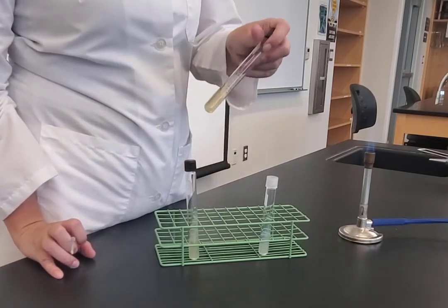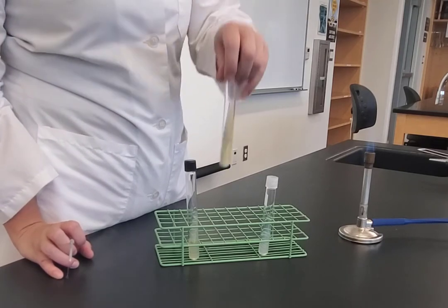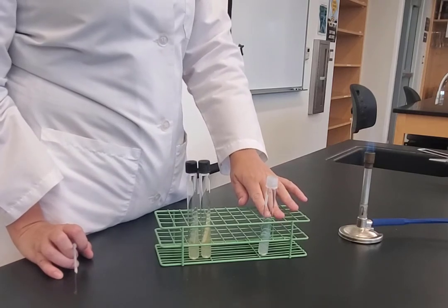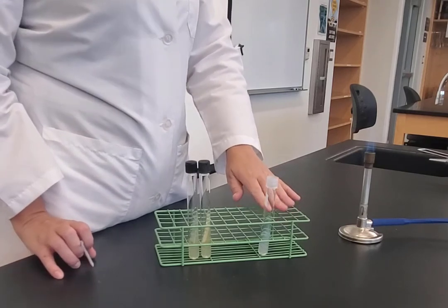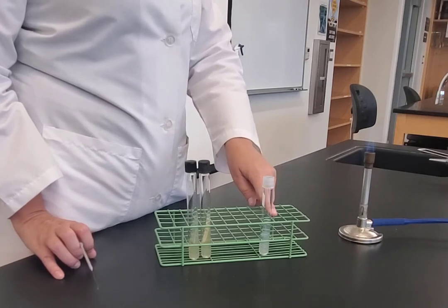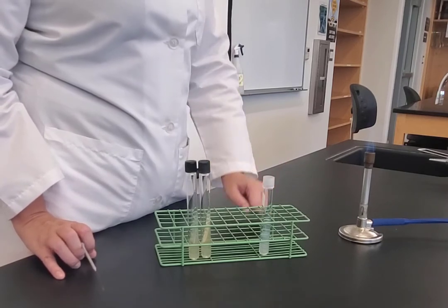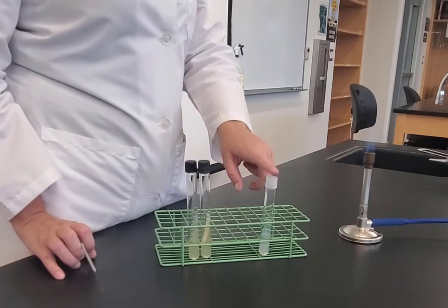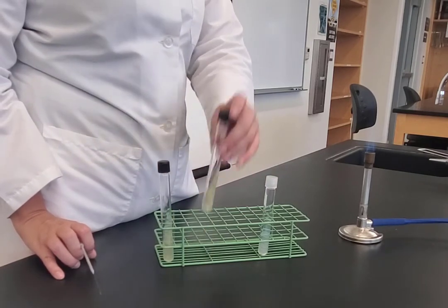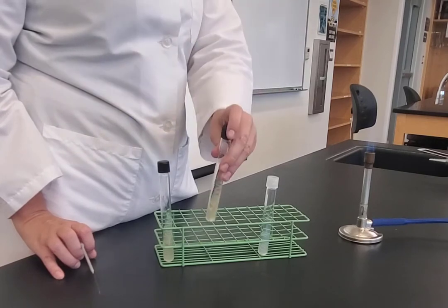You can see that they're both growing on the slant. Normally I would have two tubes — I would inoculate one with E. coli and the other with Proteus mirabilis. For demonstration purposes, I'm only going to inoculate one, so I'm going to move the E. coli out of the way and inoculate with the Proteus mirabilis.